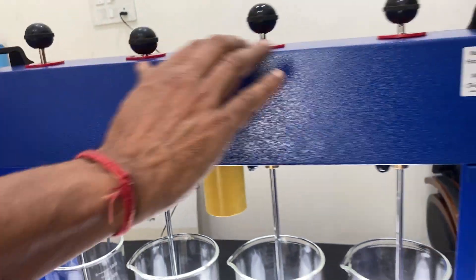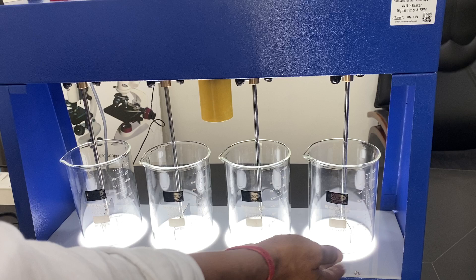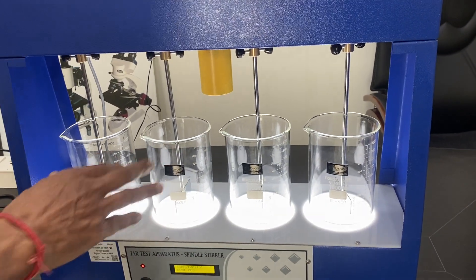This is the motor which propels all four paddles. There are four of them and you can use any one at a time or all of them together.